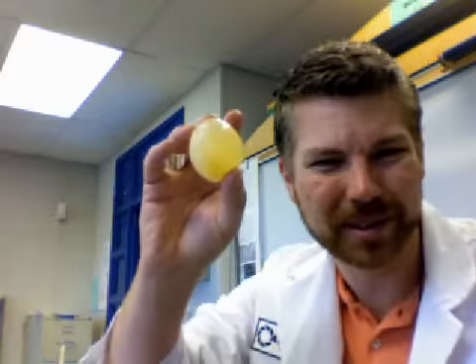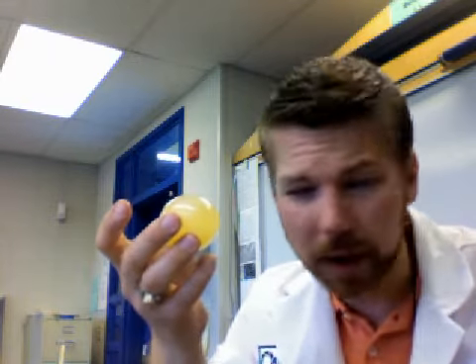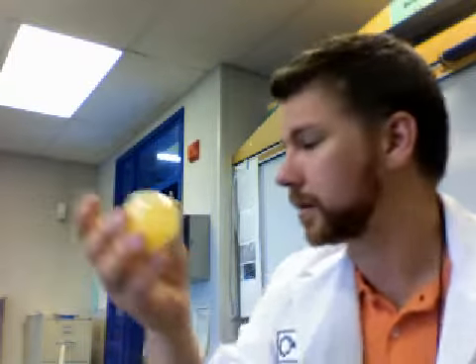Ooh, you can see it too. It's all yellow, huh? It's lost that shell. It gained mass. We took the mass again, and it gained about 2 grams of mass, which is noticeable. It doesn't look a lot bigger. It doesn't feel any fuller or firmer. But it gained about 2 grams of mass.